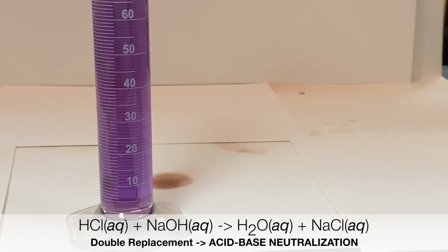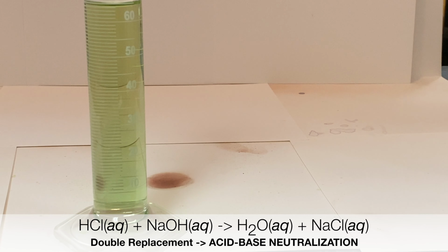Here, I'm trying to get a stoichiometric proportion of both hydrochloric acid and NaOH mixed together to get that perfect neutral pH, which is what would happen in a neutralization reaction. And here you can see a perfect quantity of 1 mole of HCl was reacted with the perfect 1 mole of NaOH to achieve that water and salt product. This is an example of an acid-base neutralization reaction.